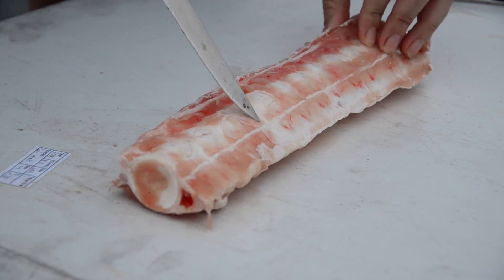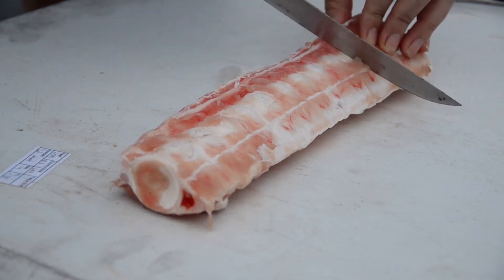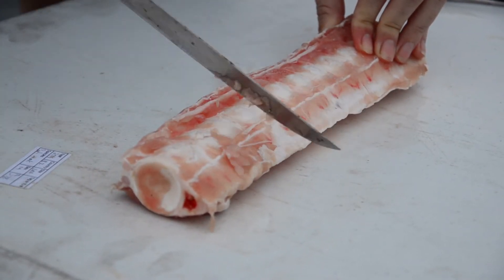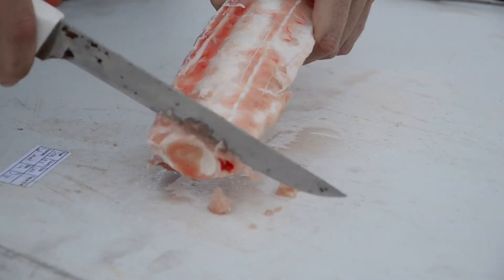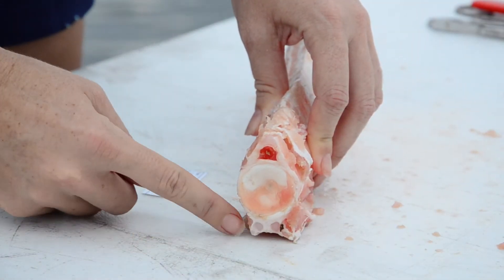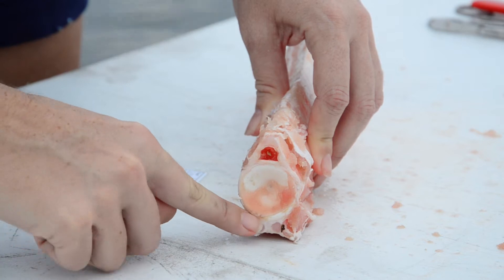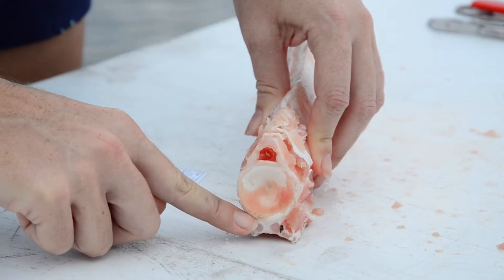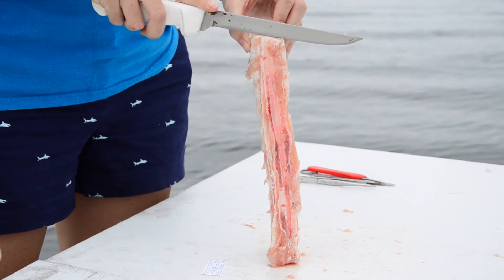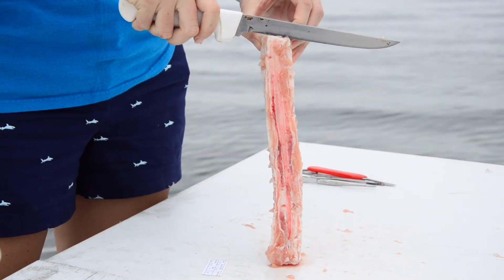Firstly I'm just going to remove the pink part — this is the muscle — and you can do that with a knife. It actually works best sometimes to scrape. This is the point where I'm aiming to cut: you can see the clear material here and then it becomes opaque. You'll be able to feel this with your knife when you start to cut.